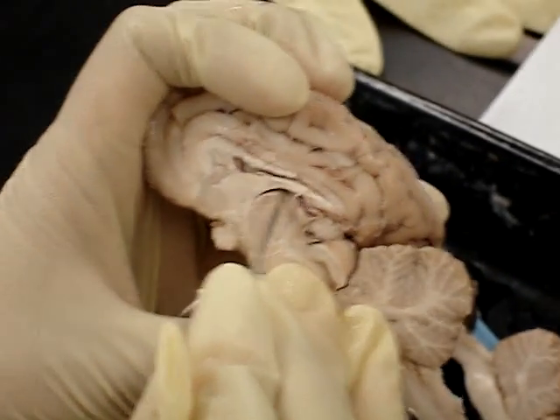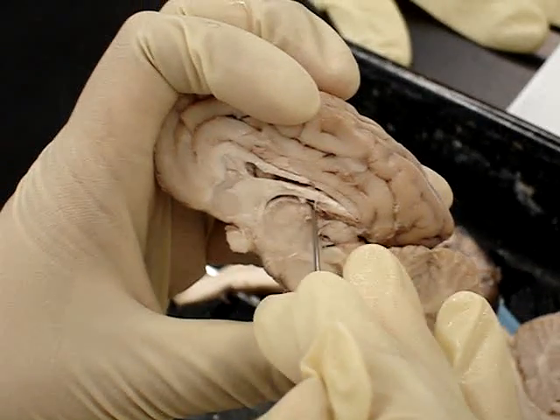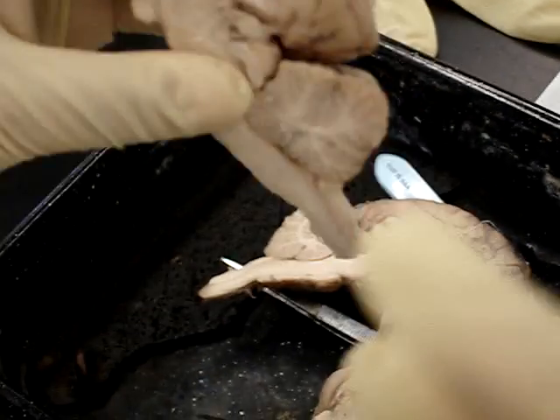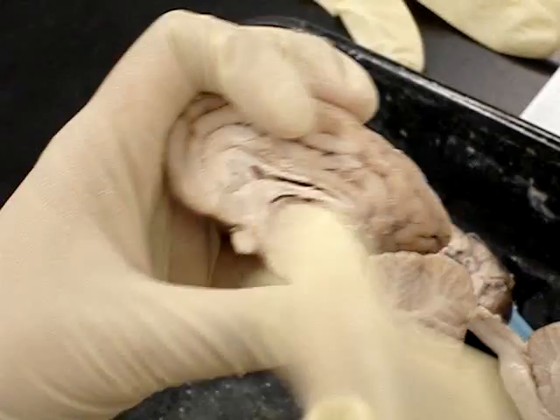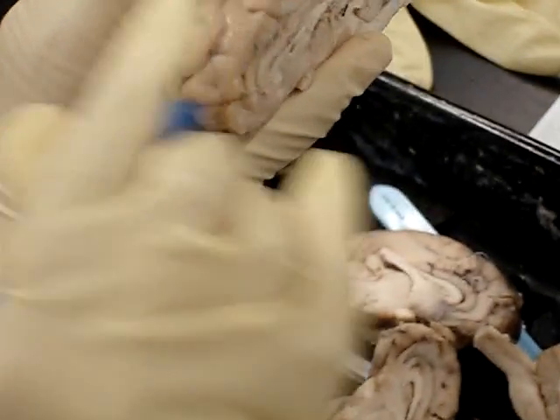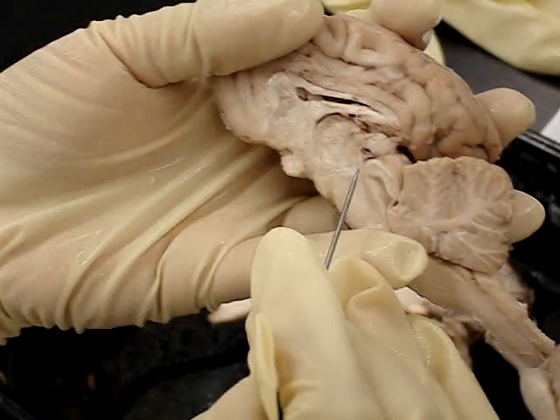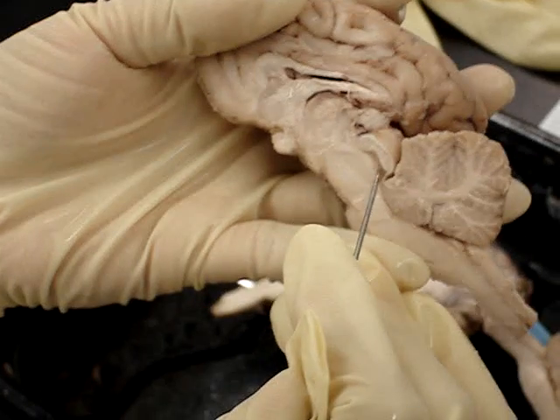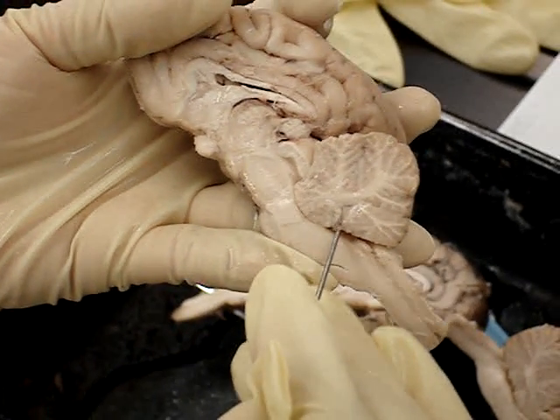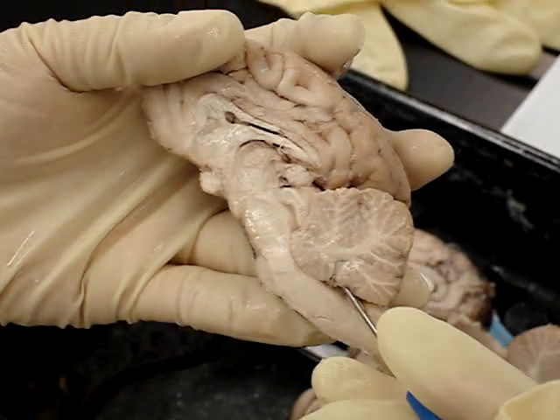The third ventricle is right here, right below it — there's another space. The two lateral ventricles empty into the third ventricle, so one here, one here, one here, and they go into one third ventricle. It goes down the cerebral aqueduct, this track right here, and this is the fourth ventricle. The fourth ventricle sits right under the cerebellum.